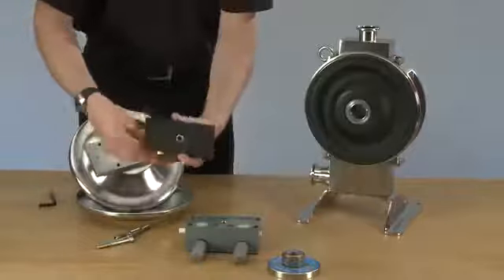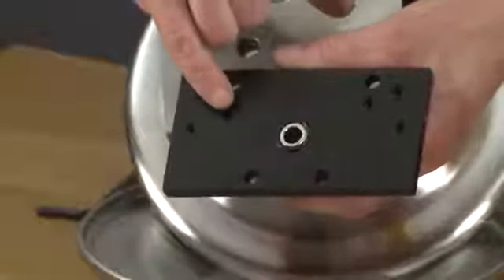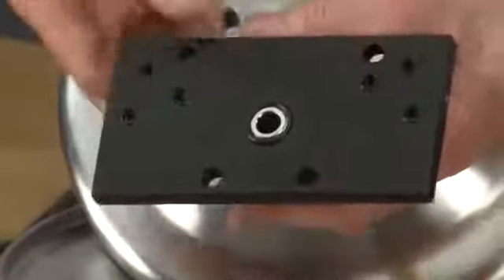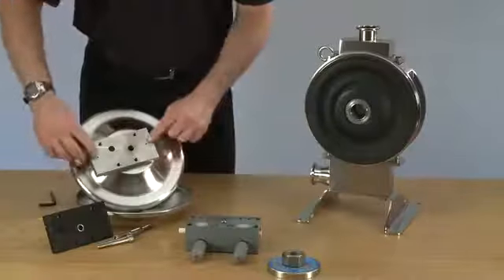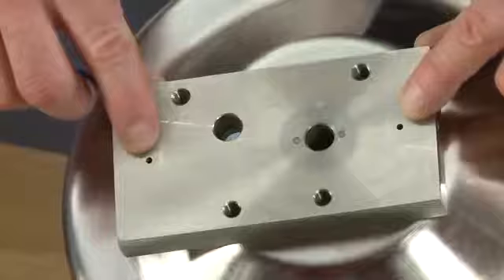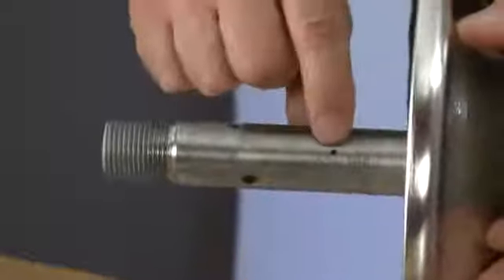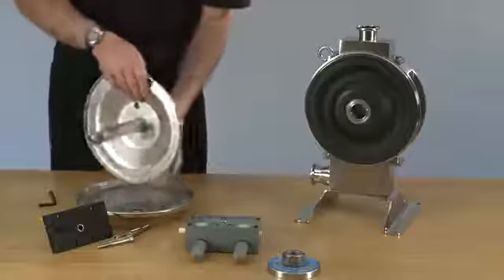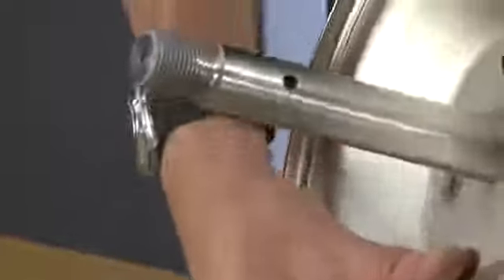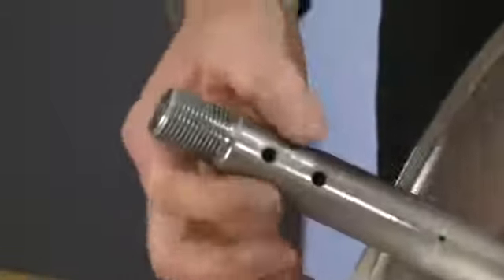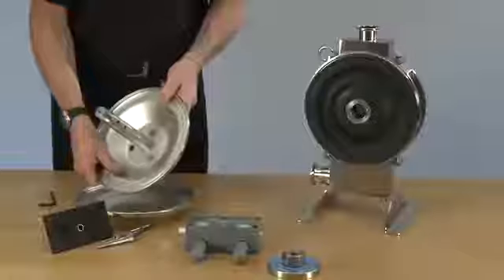We now need to check that there is no product blocking these holes on the cover plate. And also the signal holes on the air system at the front. And the two in the shaft there. And that one there. And that one there. The signal holes are clear of product. And the same holes at the end. If everything is clear, we can carry on.